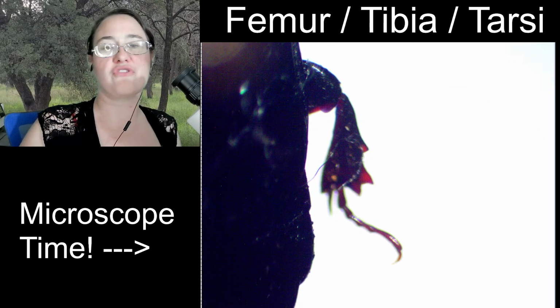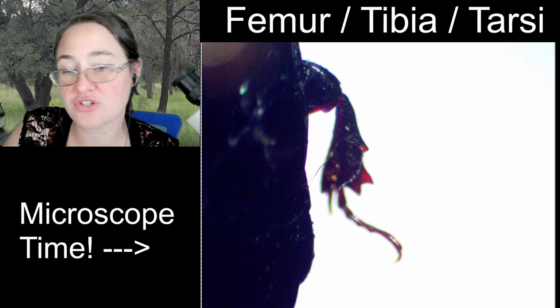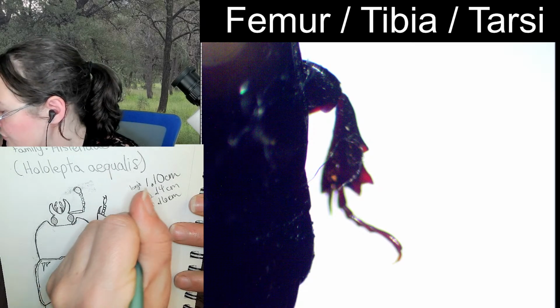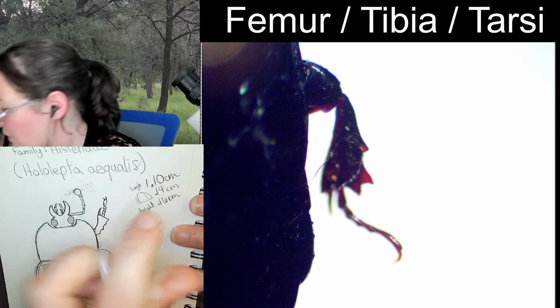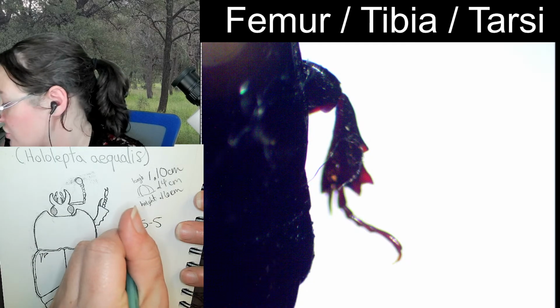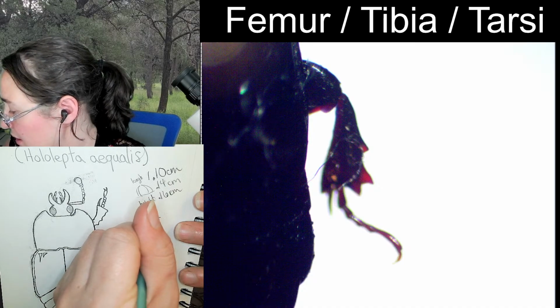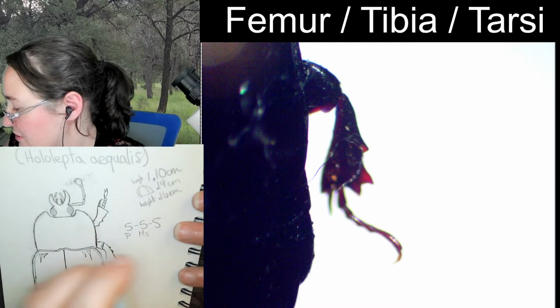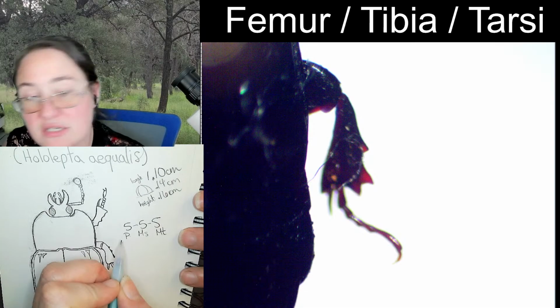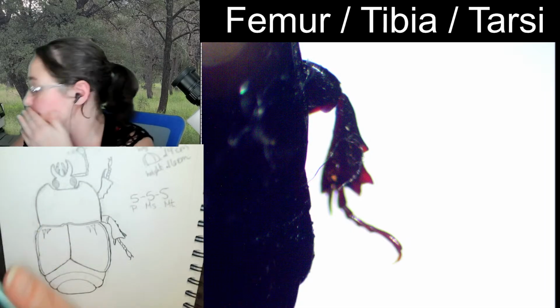So if you've been counting and you're seeing this one, you would know that the tarsal formula for this beetle is 5-5-5. We write tarsal formulas like this with 3 numbers and dashes in between them, and when you see that, you're talking about the first leg or the pro leg. The second leg would be the leg with all the meso information, and the third one is meta. But the first, the second, and the third pairs of legs.